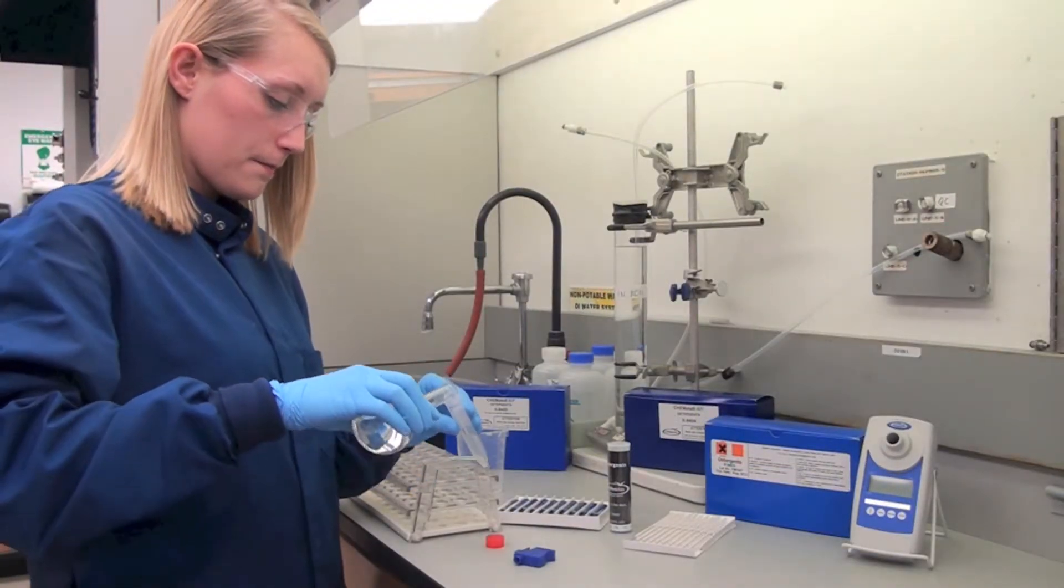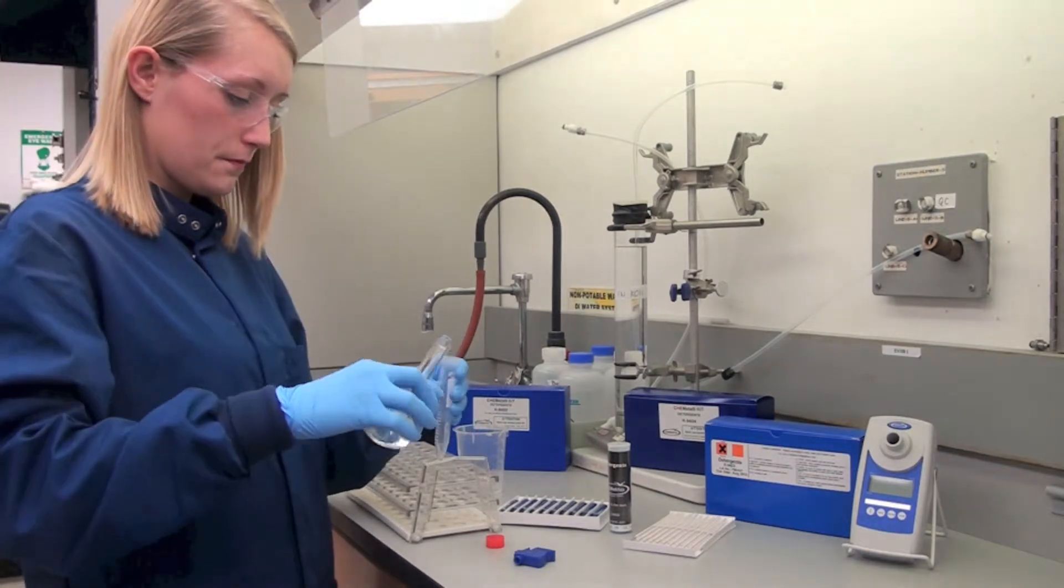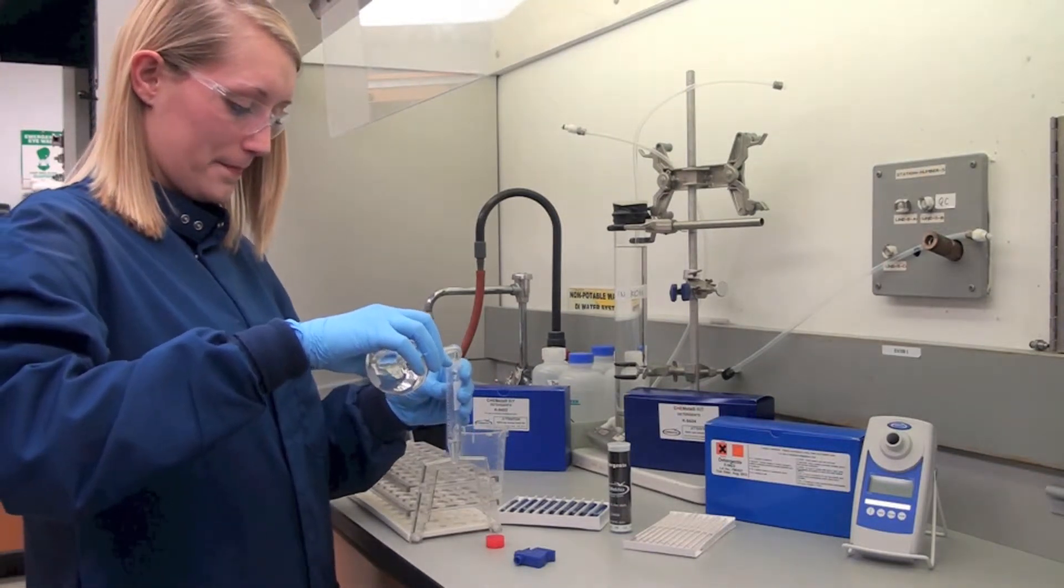Rinse the reaction tube with the sample to be tested and then fill it to the 5 ml mark with the sample.